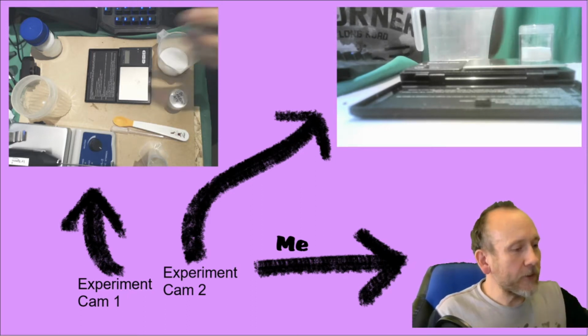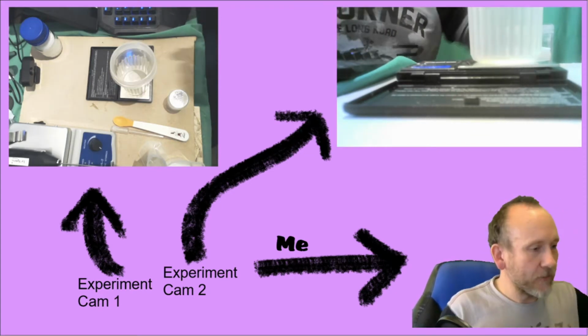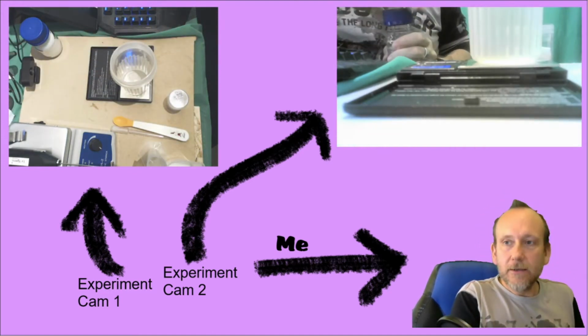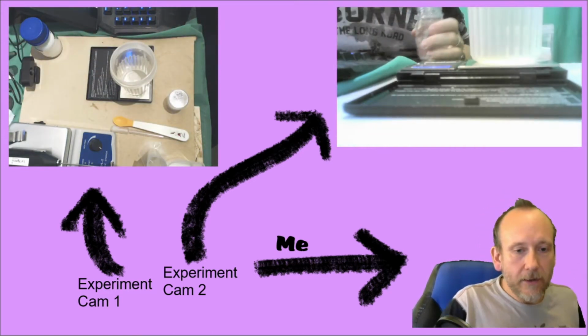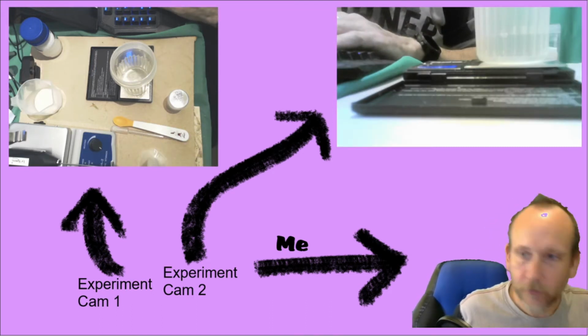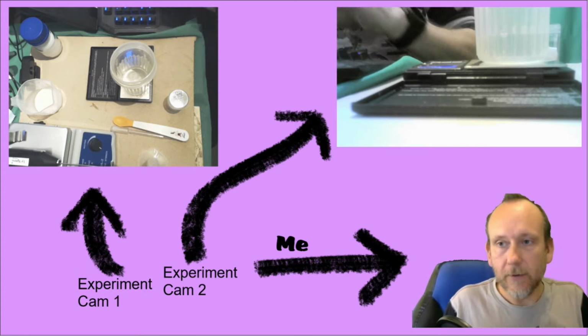So the first thing that we're going to do is weigh the container. You can say, okay, that container is 43 grams. Okay, my water next, and I will add approximately 50 grams of water. So it's 48.2 grams of water.